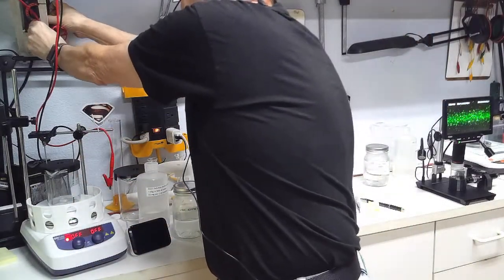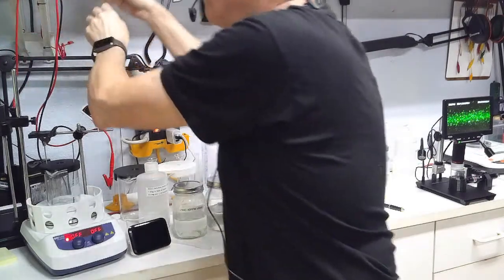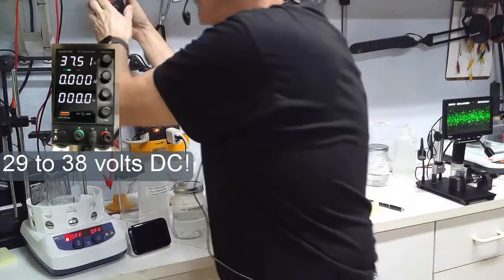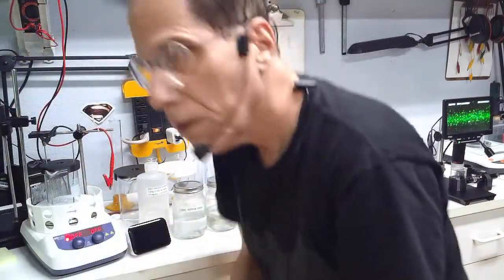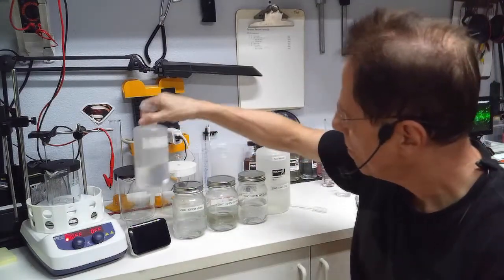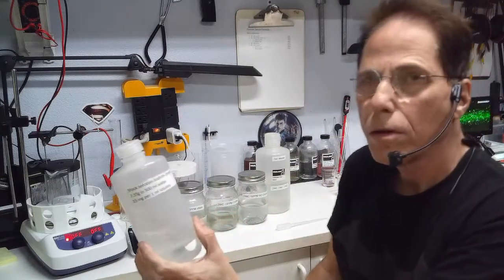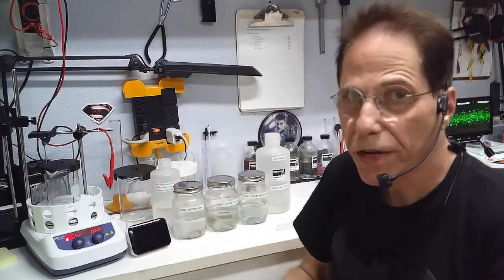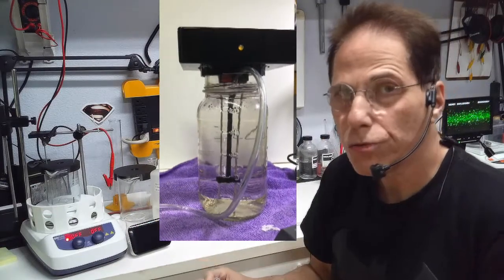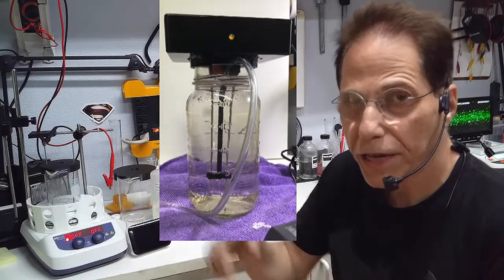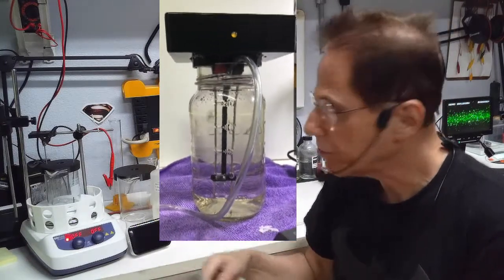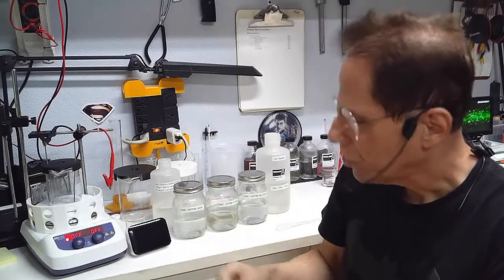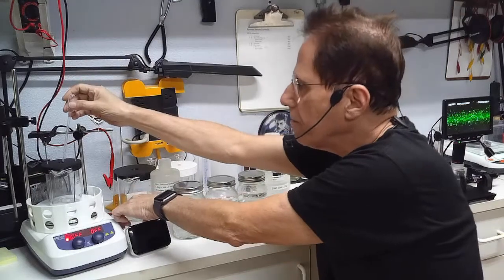This is my current meter. Any one of the current meters will work. And what you're going to do, watch that meter while you drip the sodium citrate into your mix. Now if you're using the regular silver rig that I had showed you, you need to have the aerator in there. With zinc you need to have the air currents going or you need to have some kind of a stirrer.